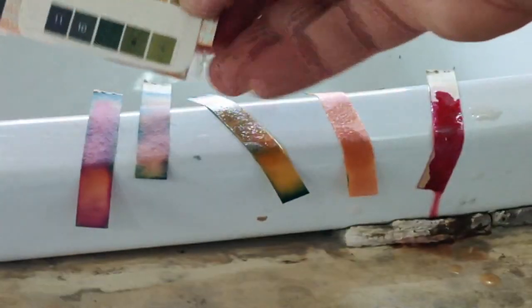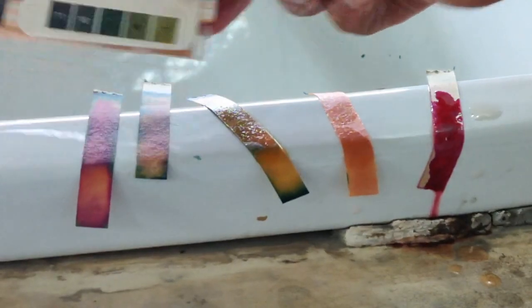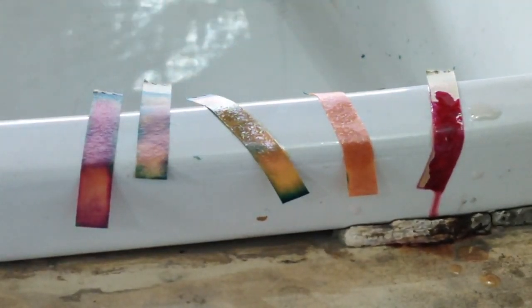And if you go to that, that was more towards a bluish, greenish side, you can see, you can match like this. So those were 2 bases. So these were bases, and this is how we use the universal indicator to detect the pH value of different solutions. So that was about the chapter acid, base and salt.